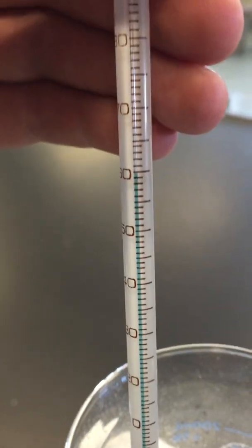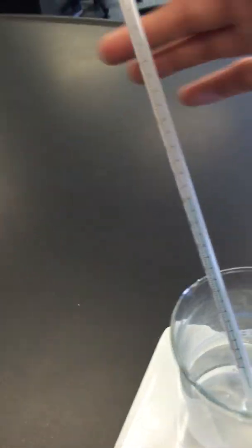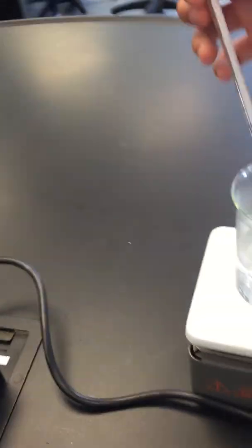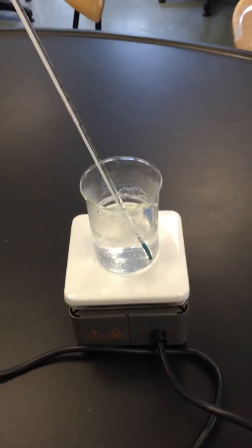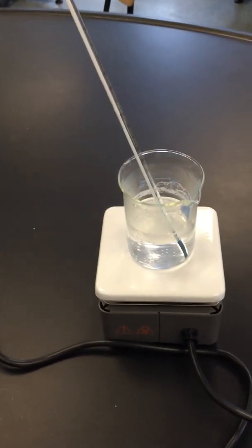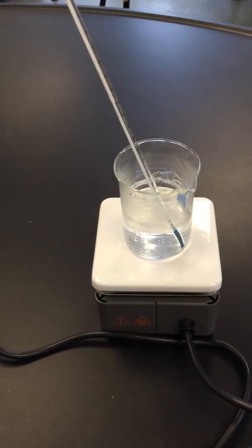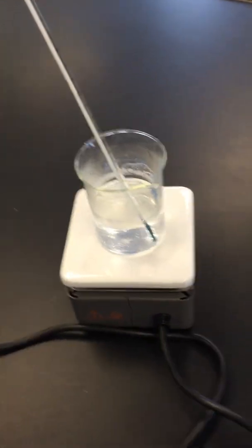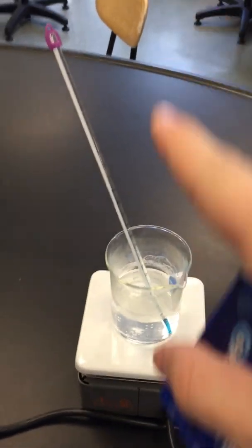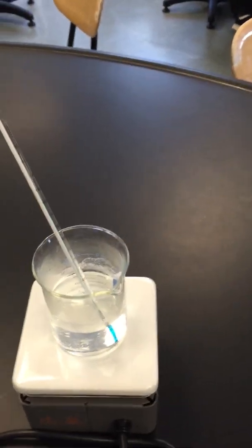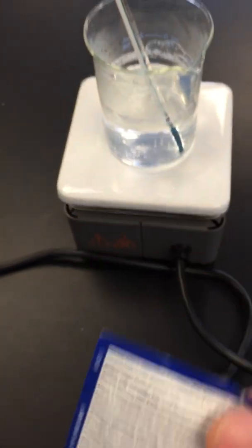All right, so let's just say, okay everyone, it's gonna be 59, so we have one beaker at 59, another beaker at 23. Record those numbers. Now I need someone to time this, so get your cell phone and time this. So I need to time this reaction, time that reaction. I need two timers - one person to time the hot one, another person to time the cold one.